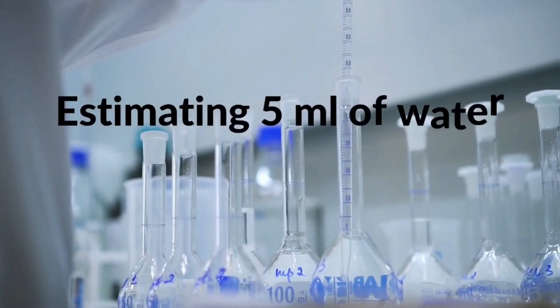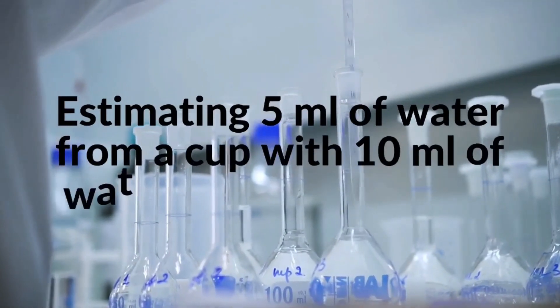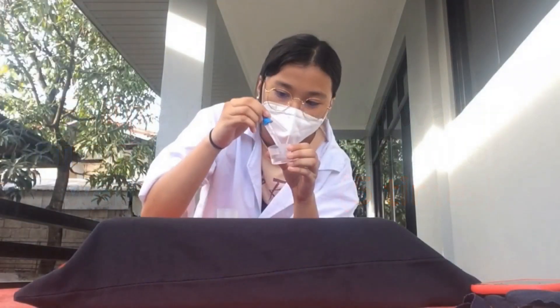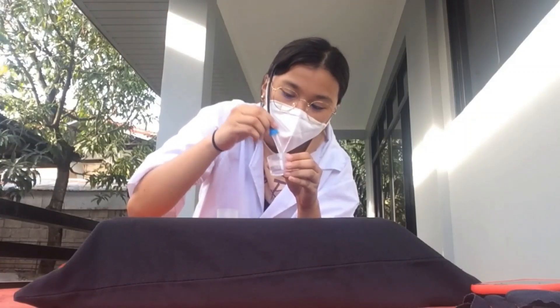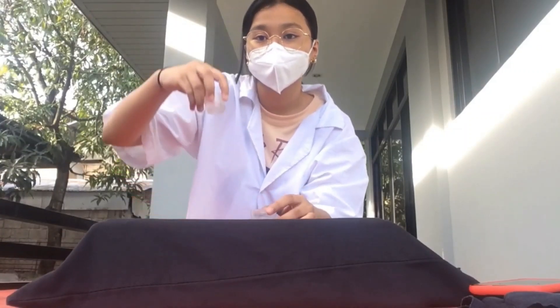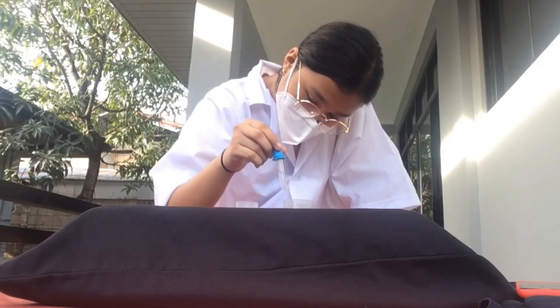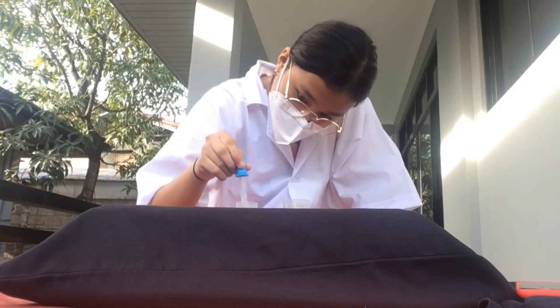The next practice estimates 5 mL of water from a cup with 10 mL of water solution, done for 5 times. I use 2 cups — one with 10 mL of water and one that is empty — and a medicine dropper in order to transfer the liquid.